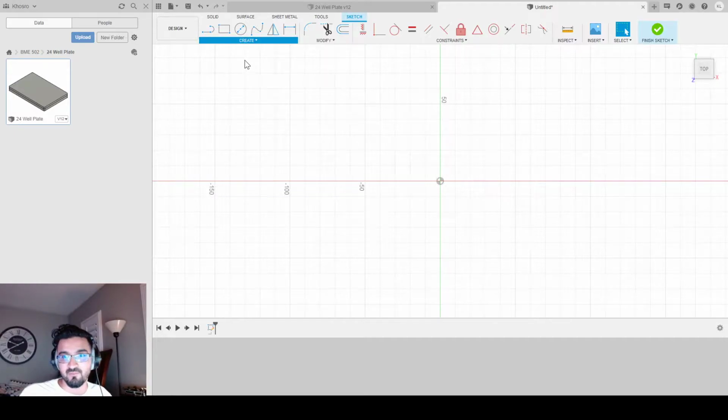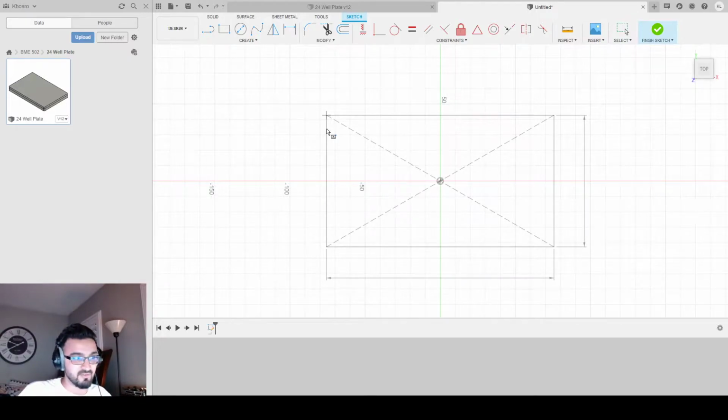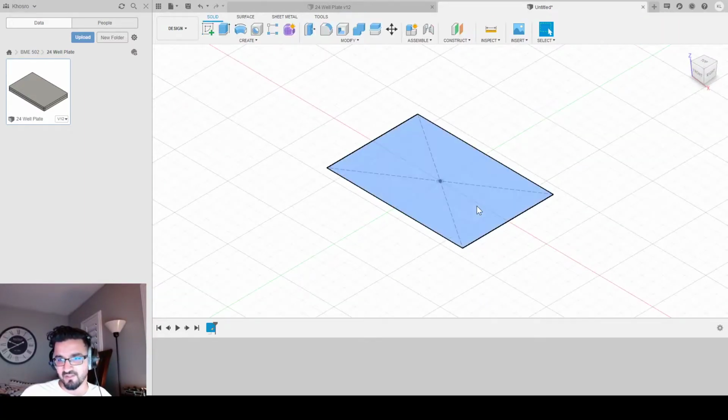So I'm going to create a center rectangle at the origin, with a height of 85.48 and a length of 127.76. And this is determined from the last design I did for a 24 well plate. If you aren't following along, I'll either post it in the comment section below, or just watch my previous video, it's the same picture, or just Google 24 well plate sketch and you'll get the dimensions of what you need. Anyway, so we're done with the first sketch. That's all we need to do.